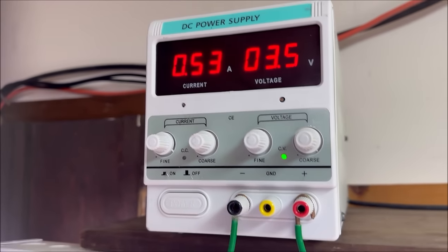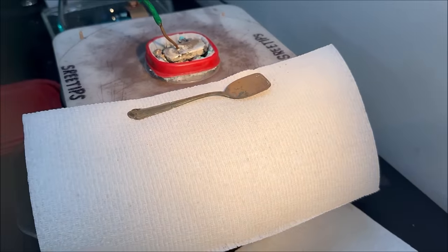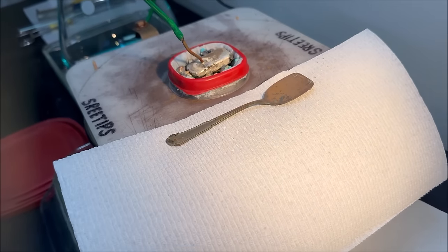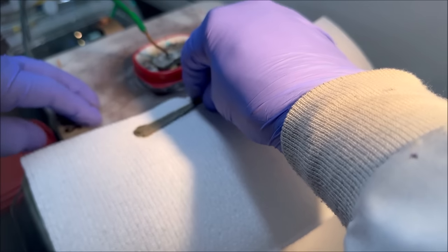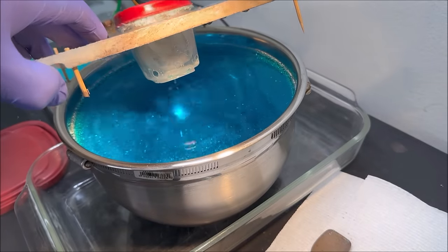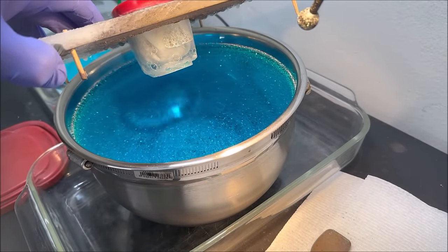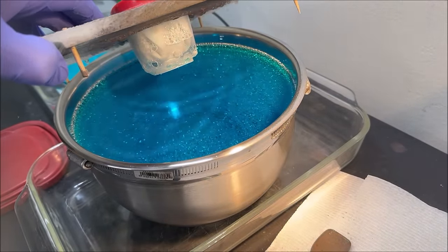The current flow has dropped way off, so let's take a look down in here and see exactly what we got going on in the cell. This is about maybe 12 to 14 hours of operation. Oh wow, look at that, that looks fantastic.